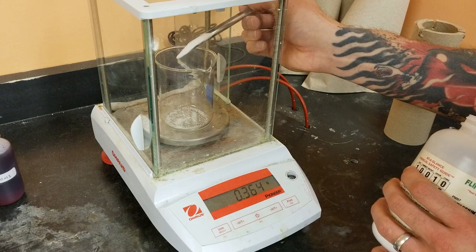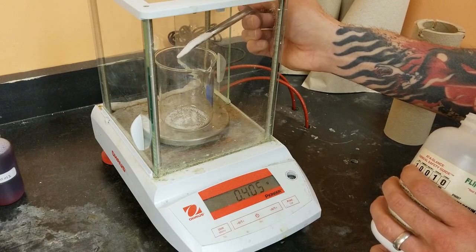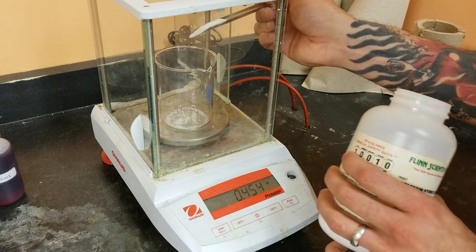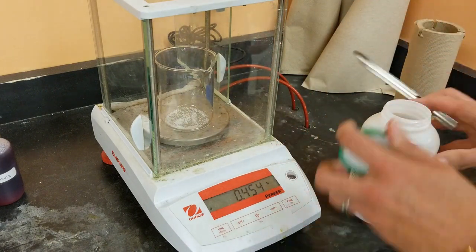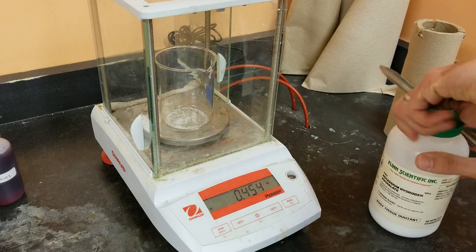We had kept it in a drying oven overnight to take all of the moisture out to ensure that this mass reading is just KHP and no moisture from the air.